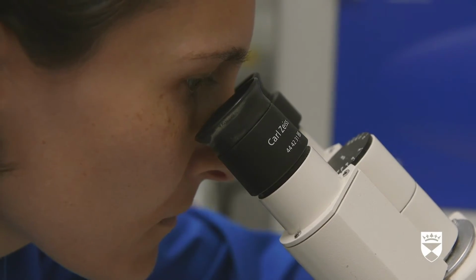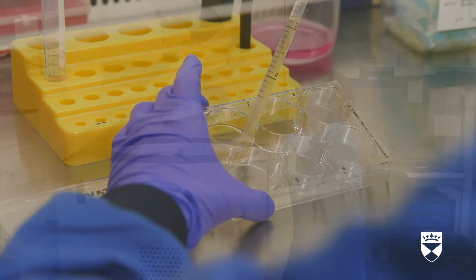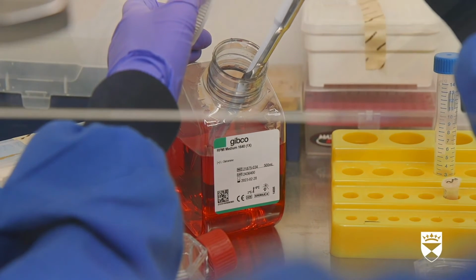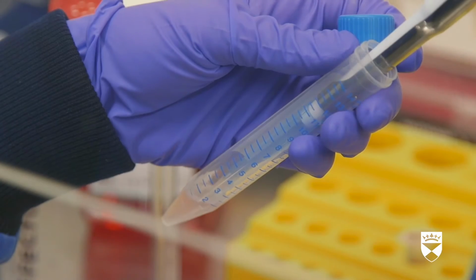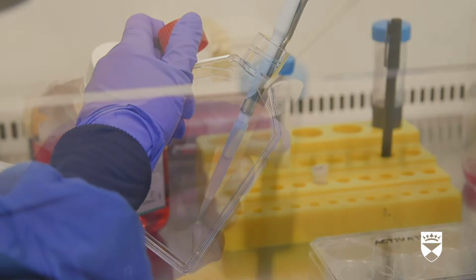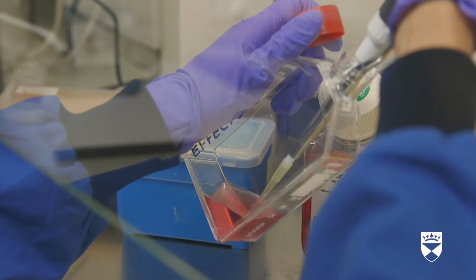We collect the cells by spinning them in a centrifuge and put them in a flask with fresh media to provide more nutrients for their rapid growth and increase in number. She extracts a red liquid media from a bottle, and then draws the cells from the centrifuge tube and adds them to a flask. She draws IL-2 from a smaller tube, and pipettes it into the flask. The flask is labeled effectors. We add a cytokine called interleukin-2, IL-2. This helps T cells to convert into effector T cells and increase in number further.